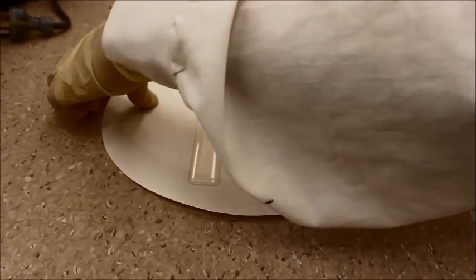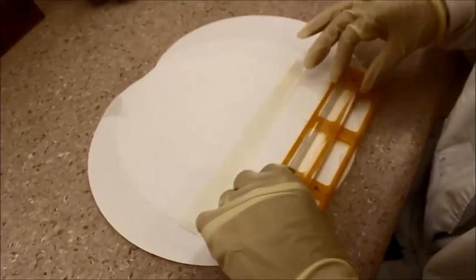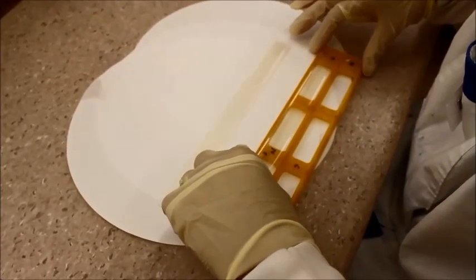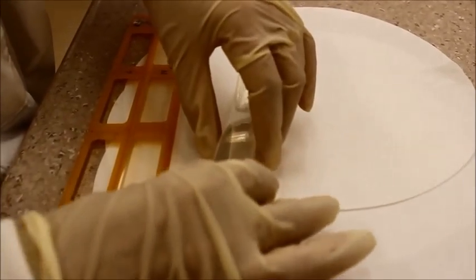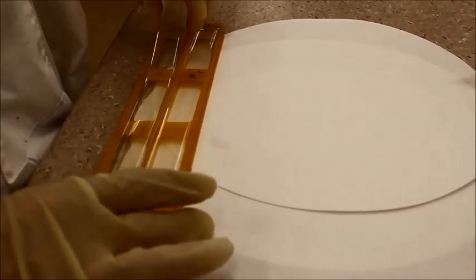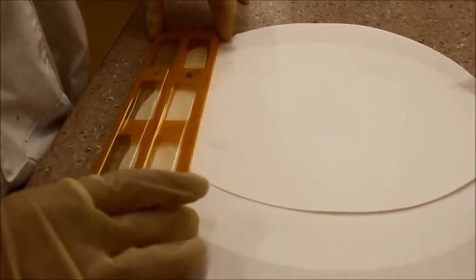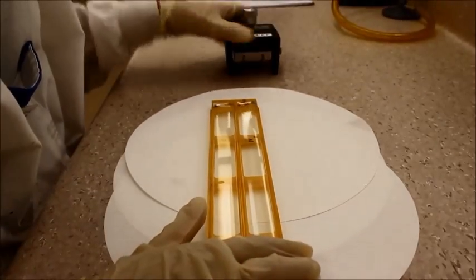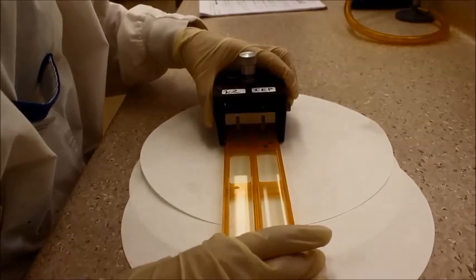Then place the gel strips onto a resting frame. With both gel strips on the resting frame, cut the pattern as shown.